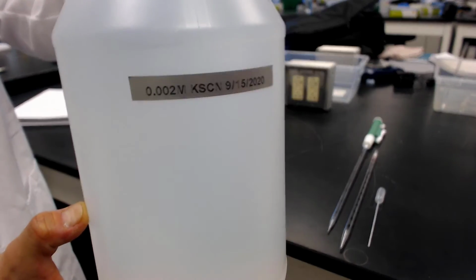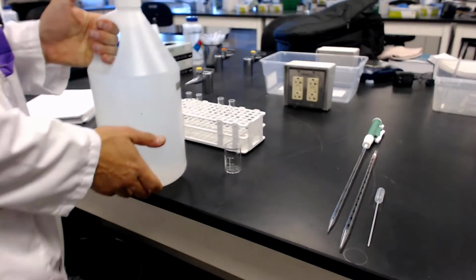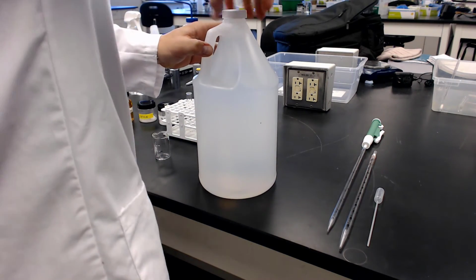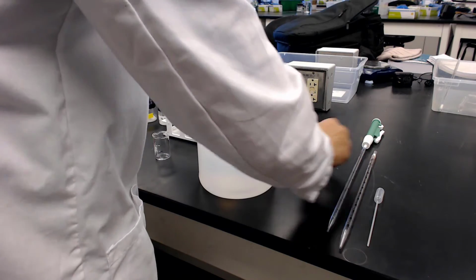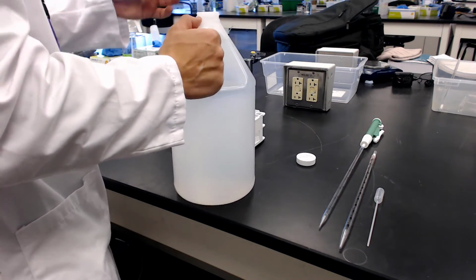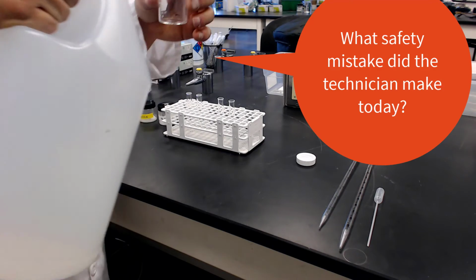So that is a little quick. Oh, so potassium thiocyanate. I thought we were using sodium, but we're using potassium. Again, it's not part of the equilibrium expression, so the cation doesn't really matter, but Jonathan is going to measure out 20 mils of this.